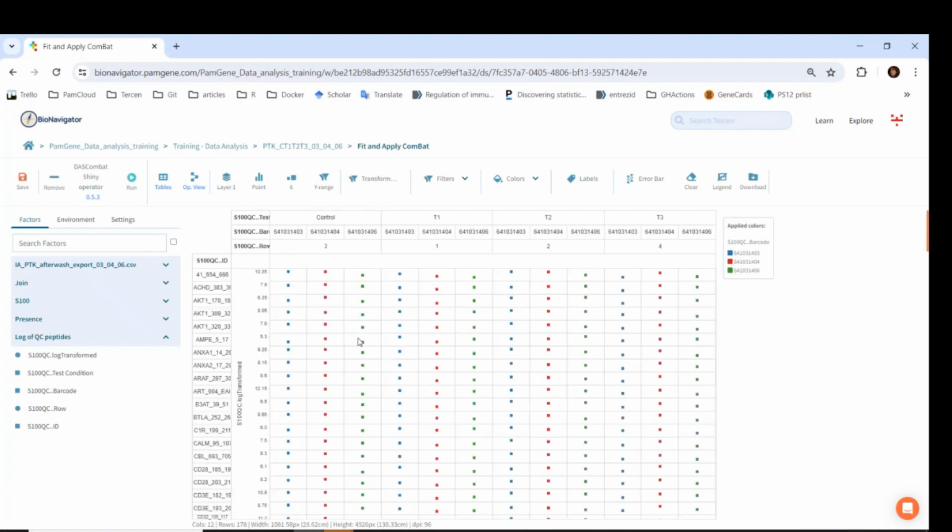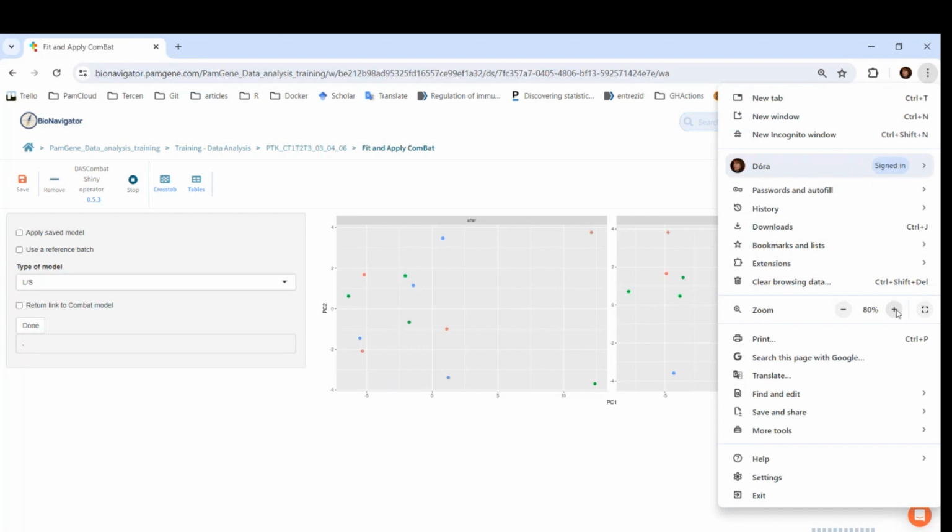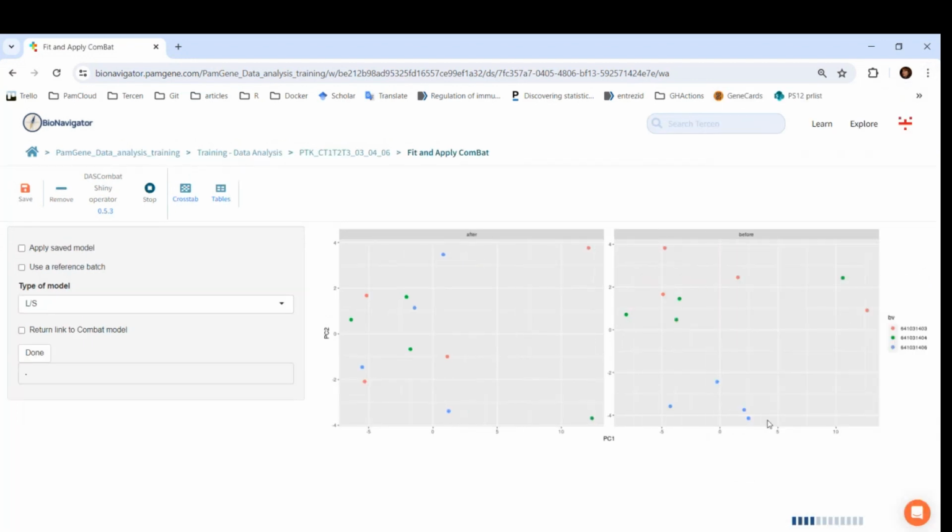The input for the Combat Shiny operator needs a coloring factor, which should be the technical batch. It is barcode in this case. Let's run it. In the operator view, you can assess whether there are batch effects and whether they have been removed by Combat. There is a PCA done before the Combat on the right side and after the Combat on the left side. We can see that the PCA before Combat contains batches, while the PCA after Combat has removed them. So we can conclude that this has worked. So let's click on the Done button. After the messages in the right bottom have disappeared, it appears under the Done button, and then we can leave the page.